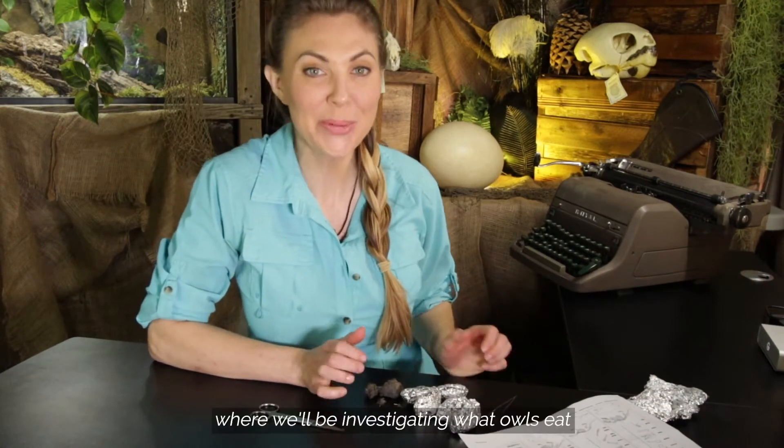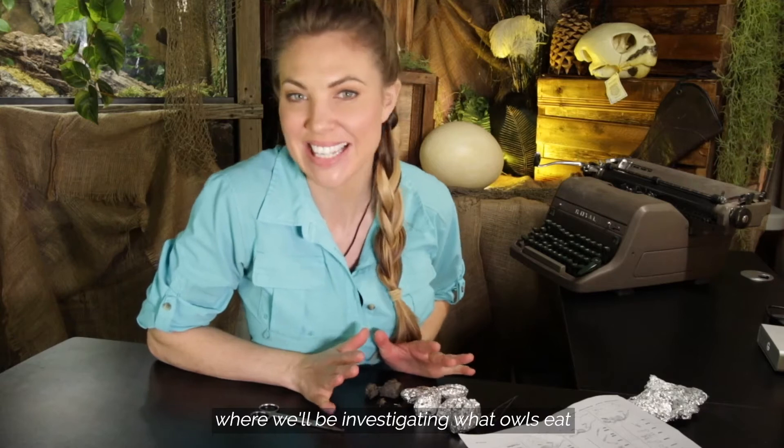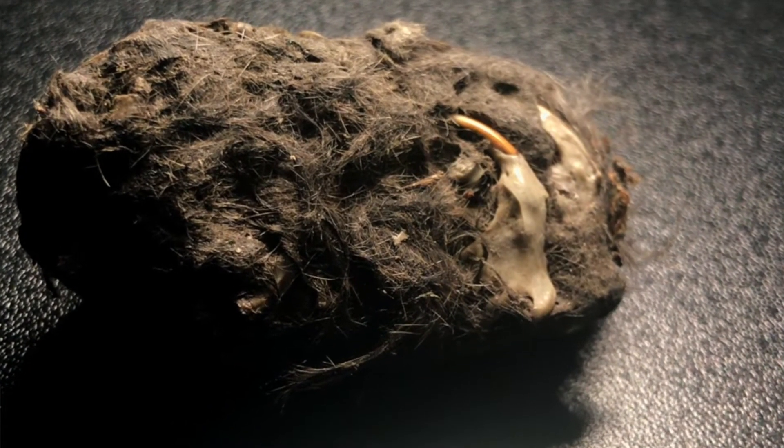Hi class and welcome to Project NOAA's Nature School Owl Pellet Activity, where we'll be investigating what owls eat by dissecting an owl pellet.